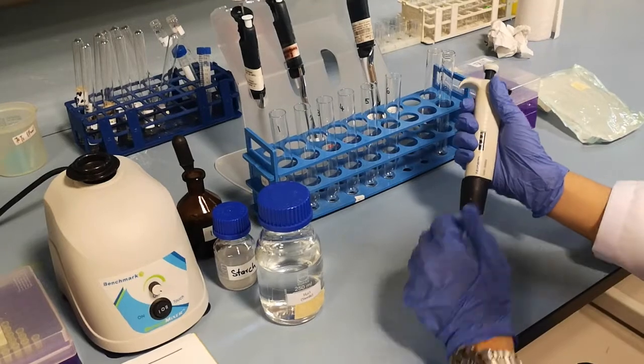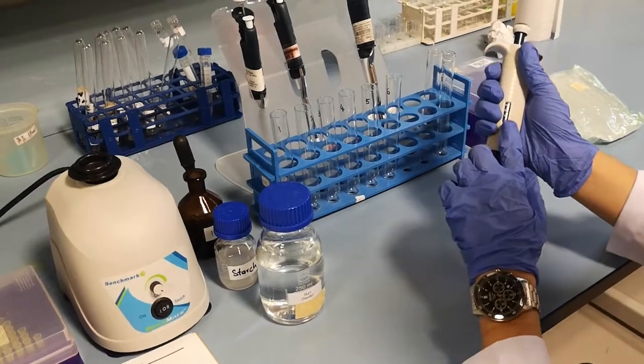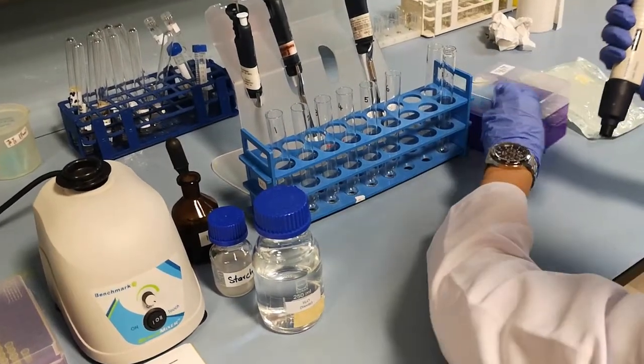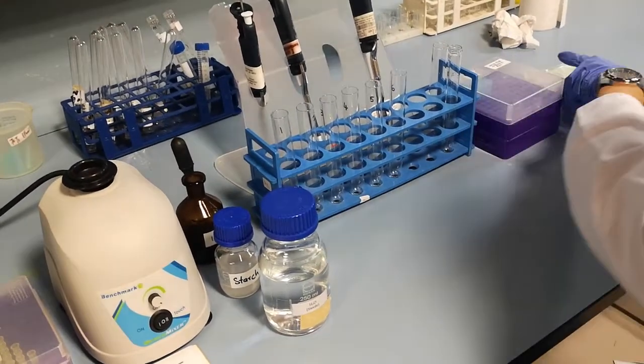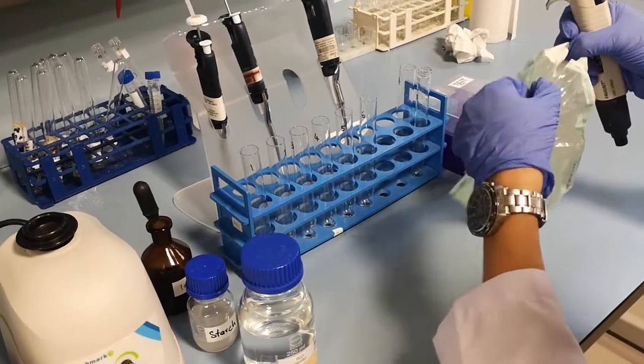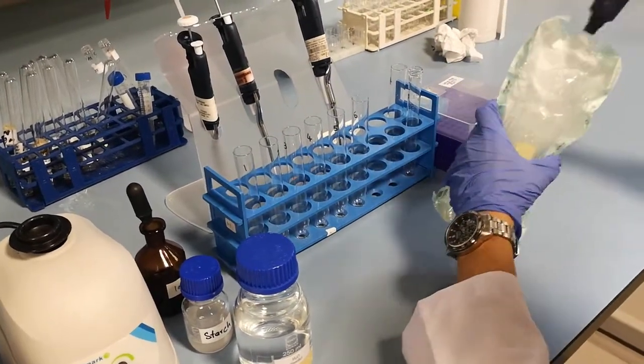As you begin your experiment, adjust the volume of the pipetter to the needed amount. Carefully attach a single tip to the pipetter.